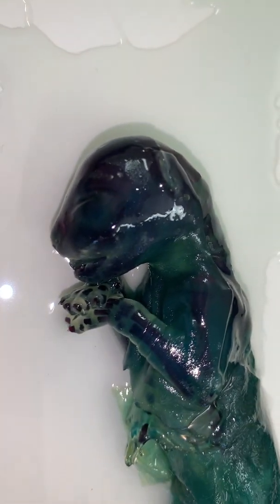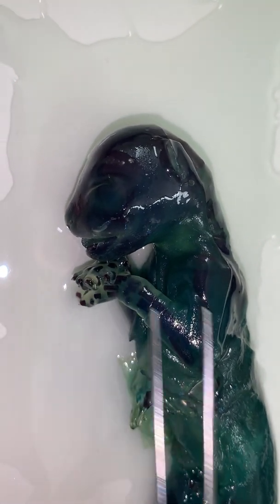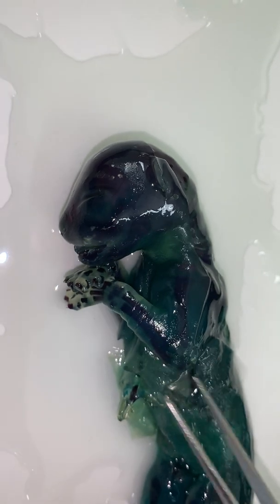So if we look at the skull, we see that the bones are fully ossified and that there are no breaks between the sutures. Let's see if we can get him over a little bit here.